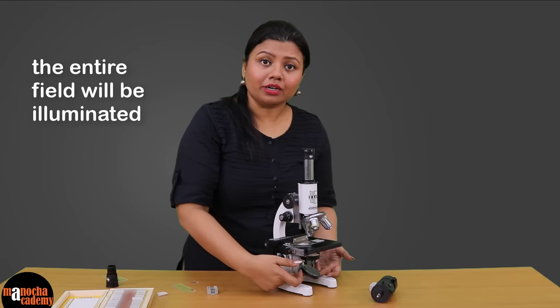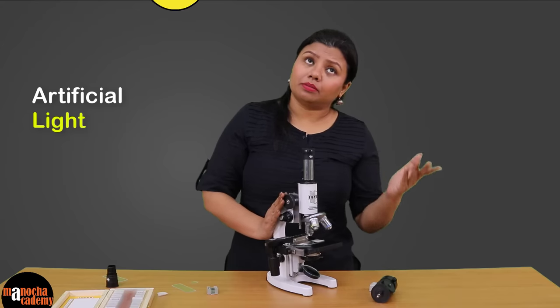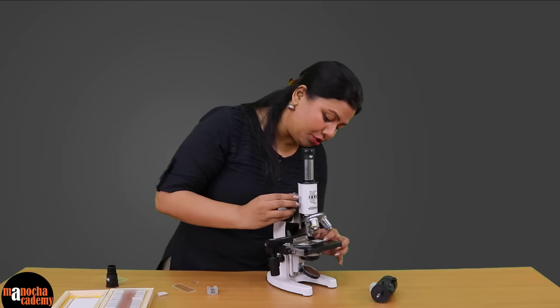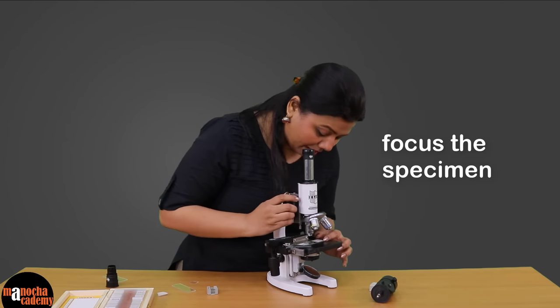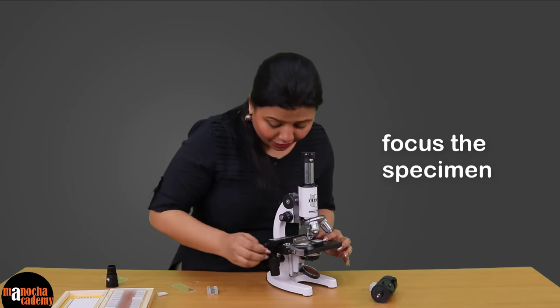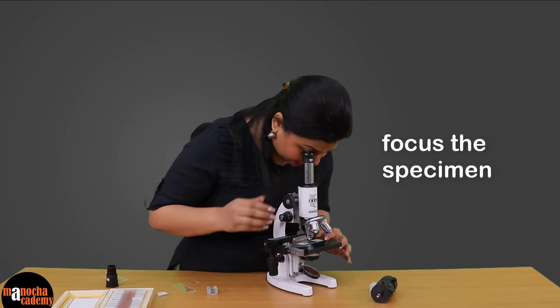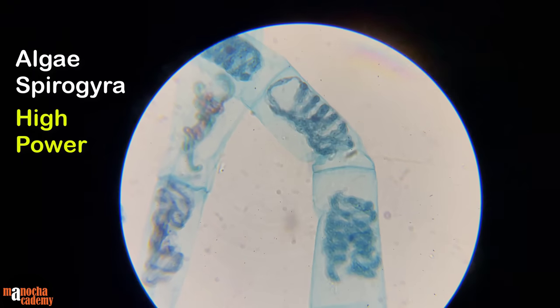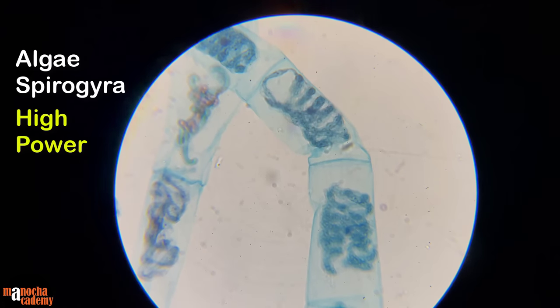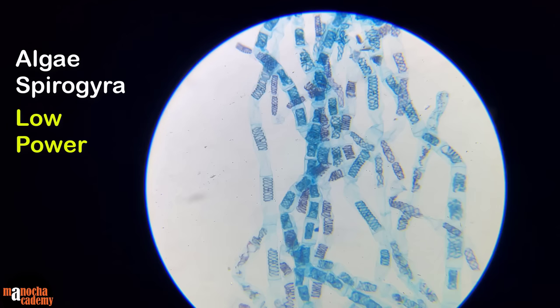When you move the mirror, it will collect light from natural or artificial sources. You can do this in front of an artificial light or in front of a window through which sunlight is coming in. Then you start adjusting your focus by moving the coarse adjustment screw, and you can move your slide right or left to bring the specimen right beneath the objective lens. Now I can see a very distinct view of the algae spirogyra under my microscope — this is how the specimen looks under the microscope in high power and in low power.